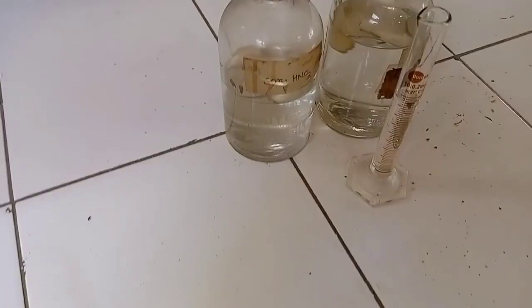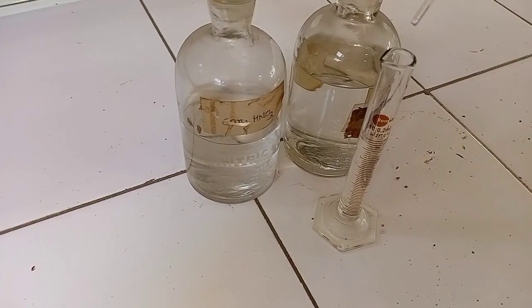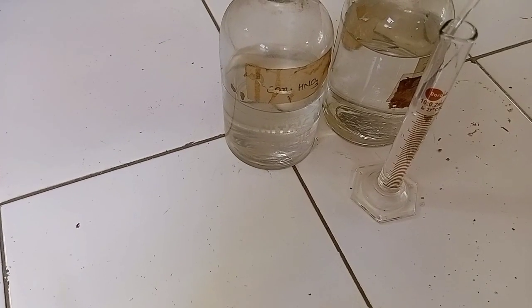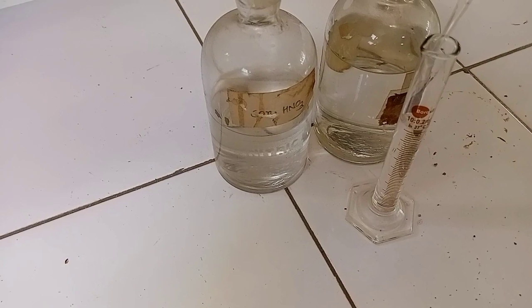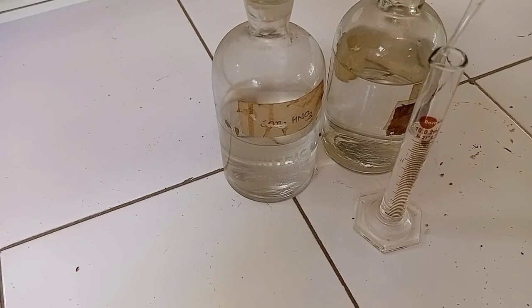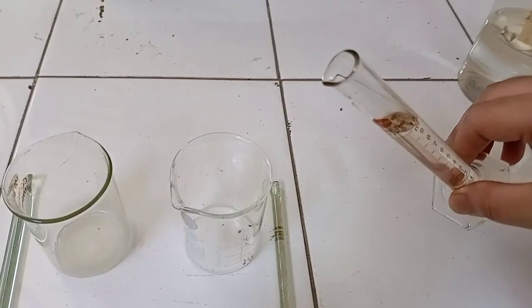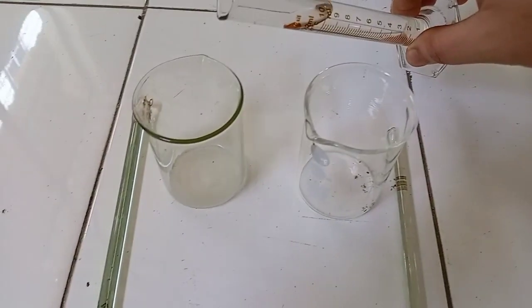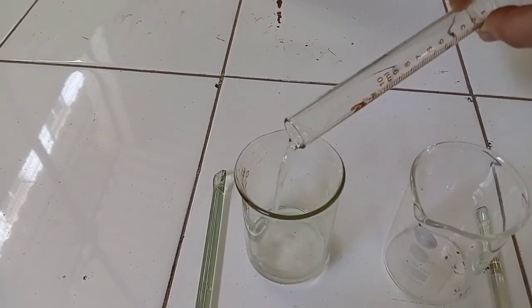The reagent I am using in this experiment is concentrated HNO3, which is the formula of nitric acid. I am taking 10 ml of nitric acid in each beaker — 10 ml in the first and 10 ml in the second beaker.